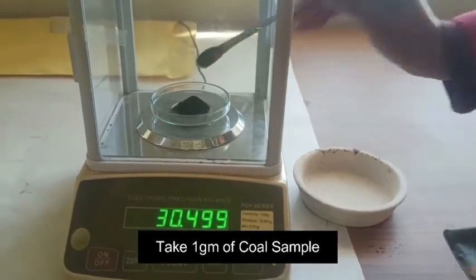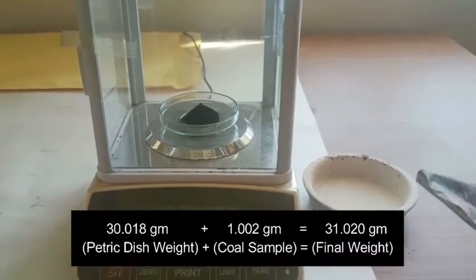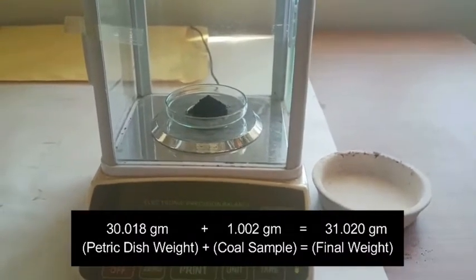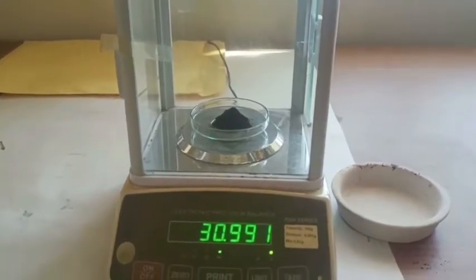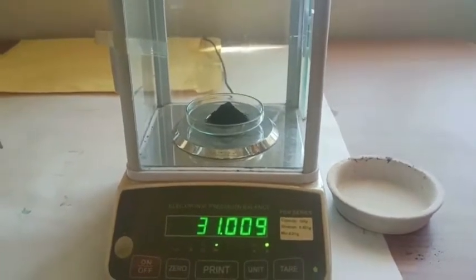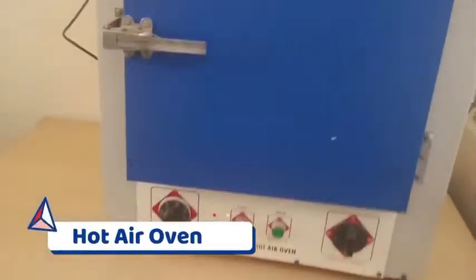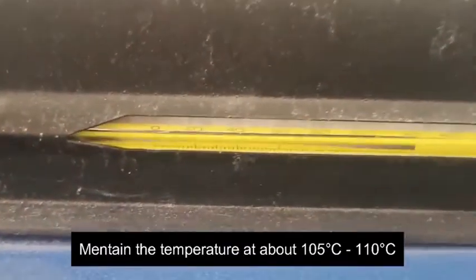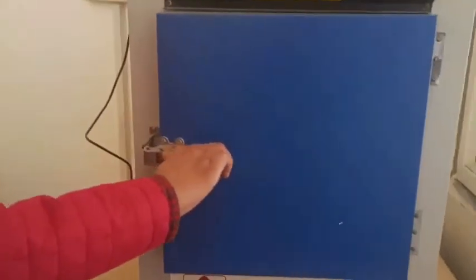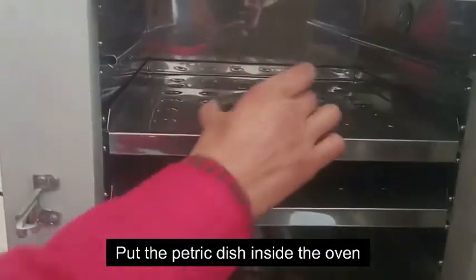We are going to weigh one gram of coal sample. You may have a question: why didn't I tare? I didn't tare because I need to weigh this petri dish again after heating, so taring at this point wouldn't help me. So this is one gram of coal sample taken in the petri dish. Here is the hot air oven — its temperature is set at 105 to 110 degrees centigrade — and in this preheated oven I am going to keep my petri dish with the coal sample.